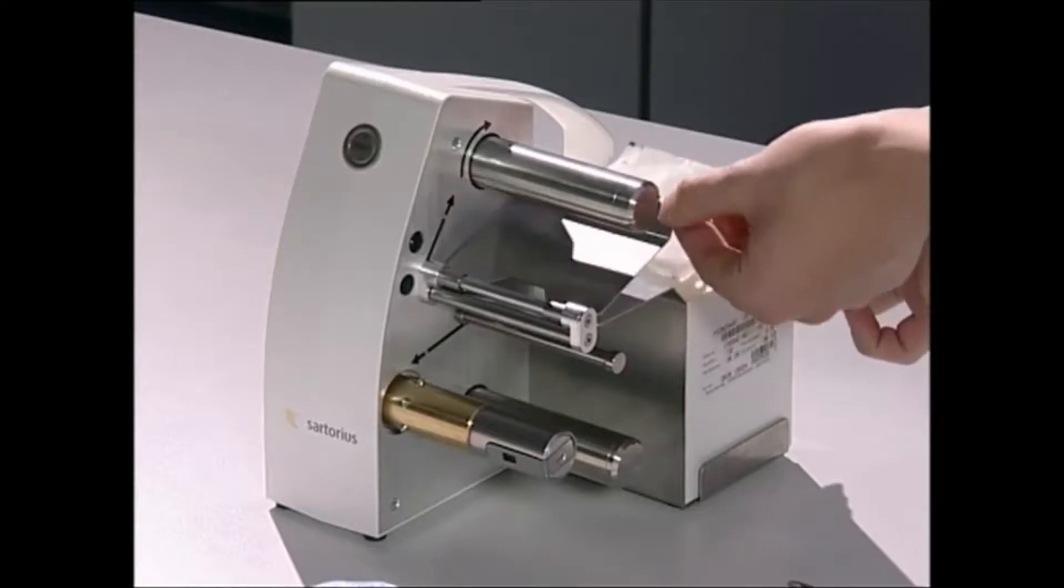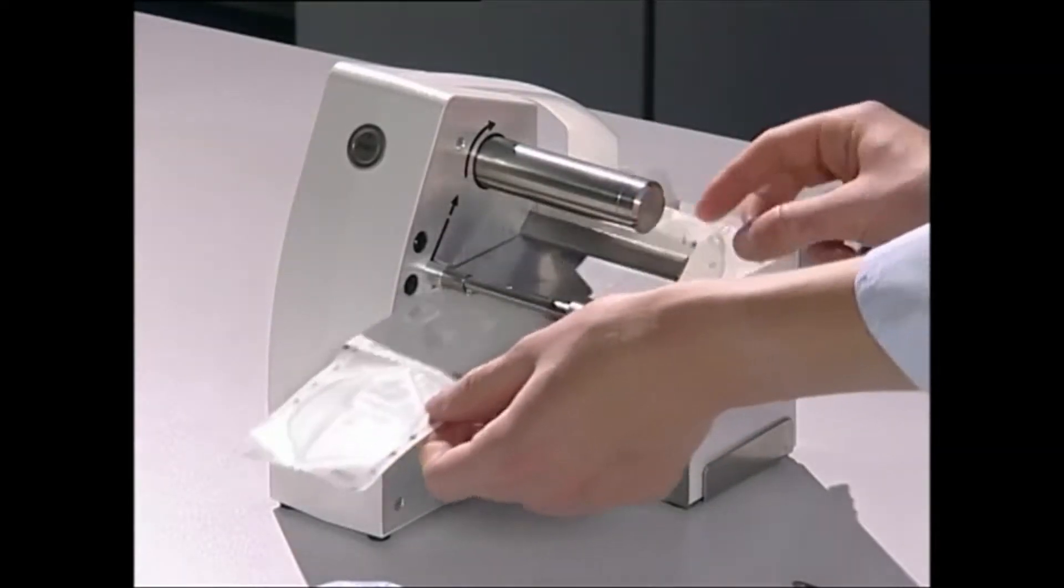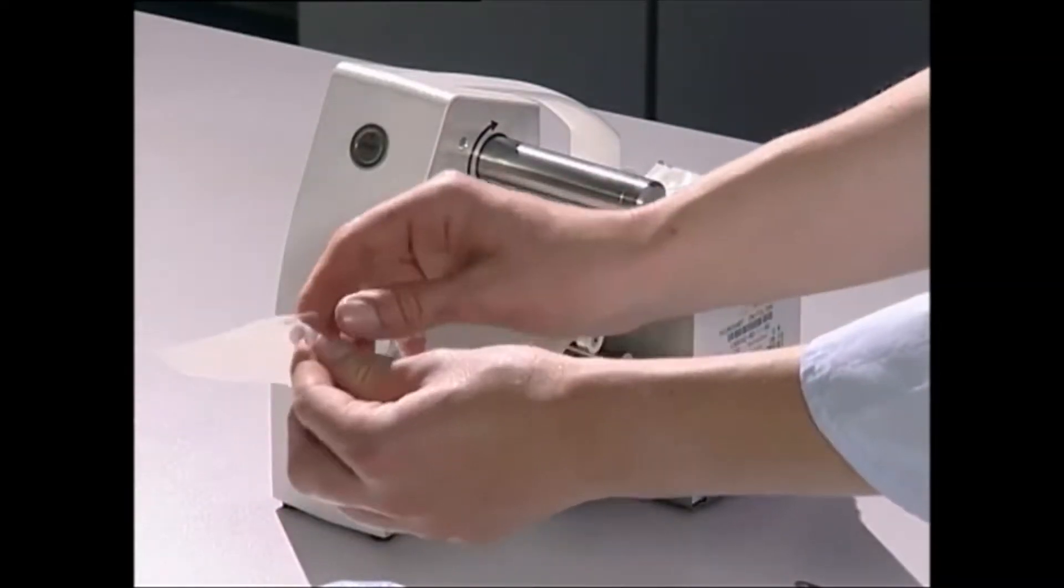Open the hinge, push in the membrane strip, and keep pulling it out on the other side until three to four packaging units can be seen.